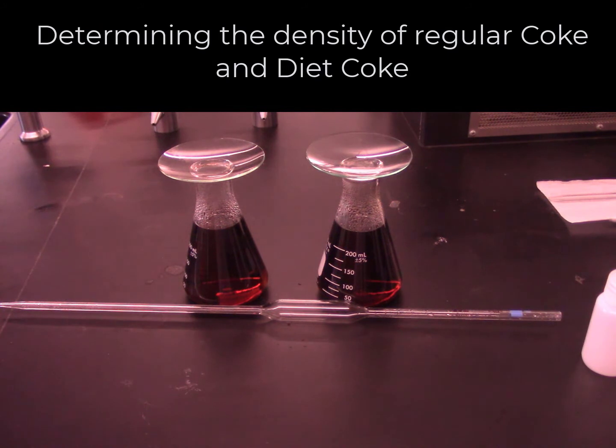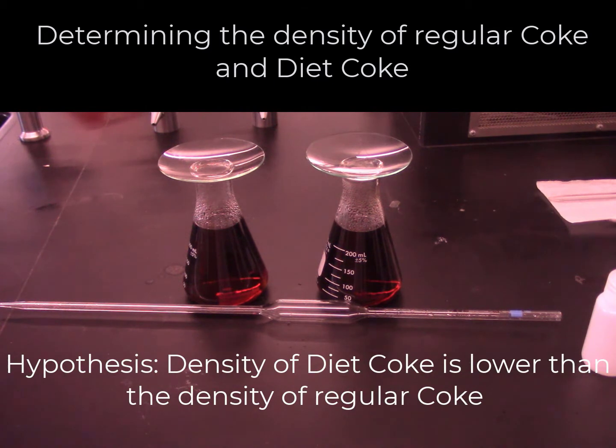So what do you think? Do these samples have the same density? I think that their densities are different because regular Coke has sugar in it and Diet Coke has a very small amount of artificial sweetener in it. Our hypothesis is that the density of Diet Coke is lower than the density of regular Coke.